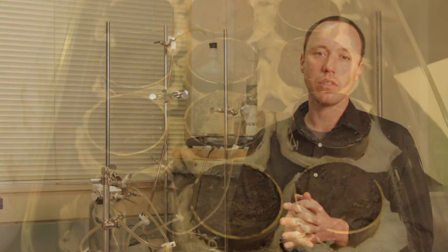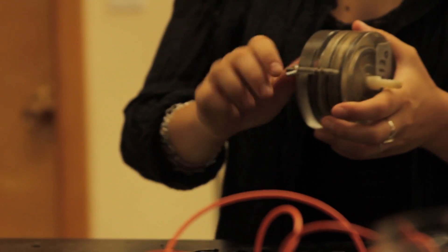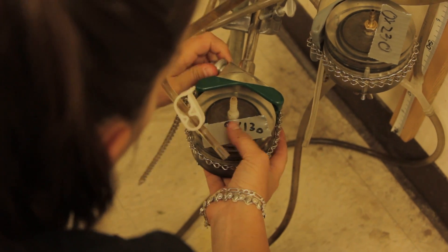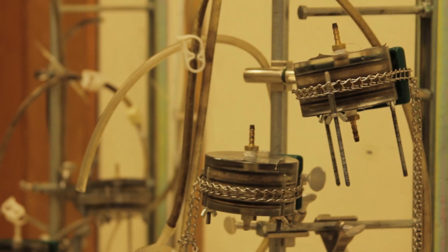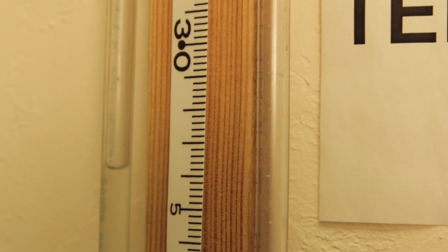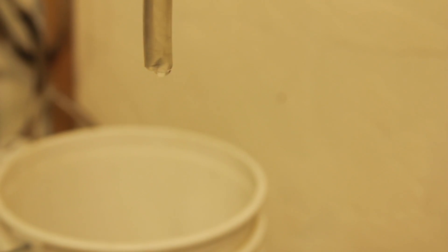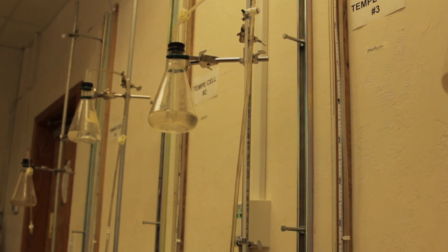What I'm really interested in is how water moves through these soils. This is the standard setup to measure the hydraulic conductivity of soil — basically how easily water passes through. The idea is that you pass a flow of water through the sample and measure both the pressure across the sample and the flow of water coming through, and that allows you to determine its hydraulic conductivity.